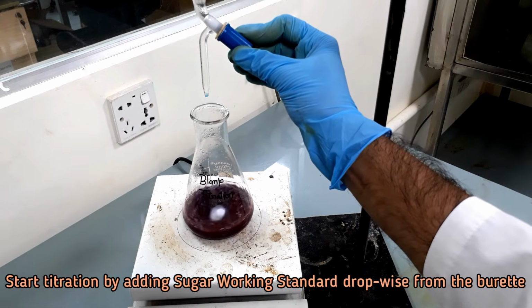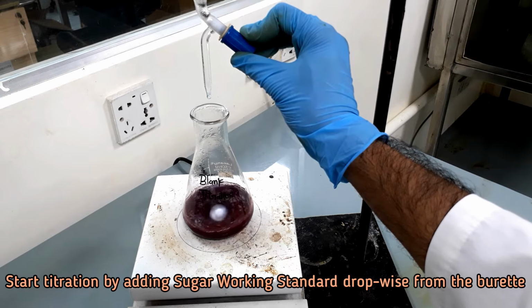Let's start the titration by adding sugar working standard solution dropwise from the burette.